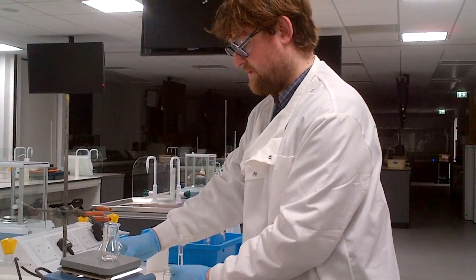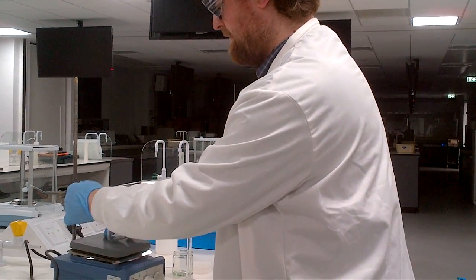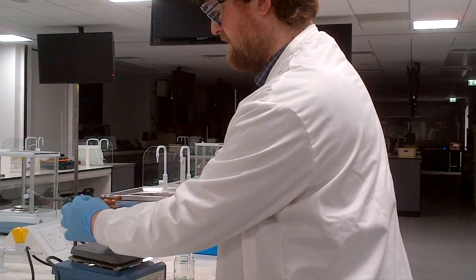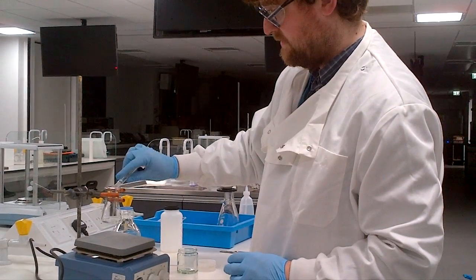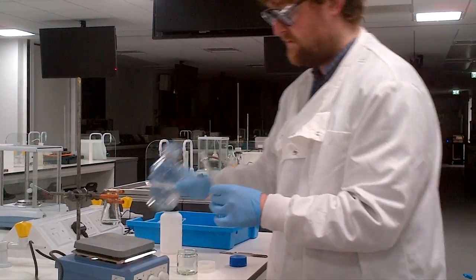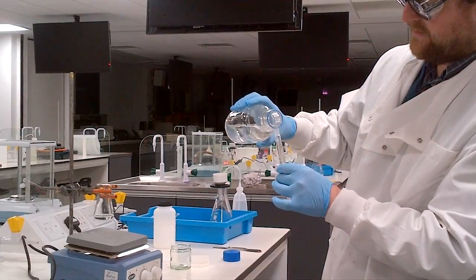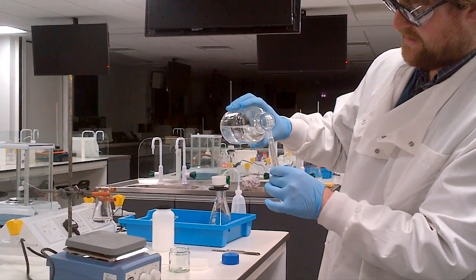So what we'll do is clamp into position the flask gently, and put in the ethanol. So that's 10ml, we'll put in another 10ml.